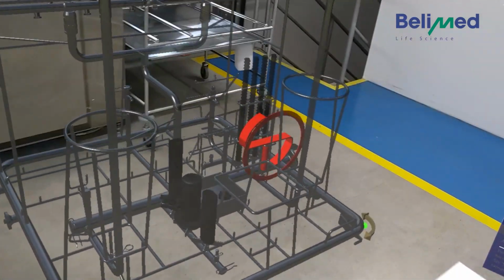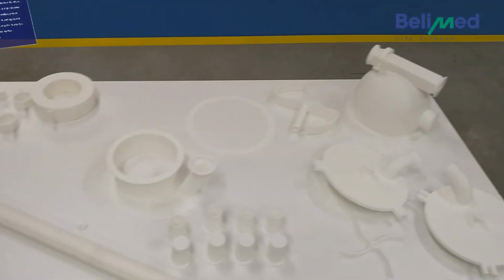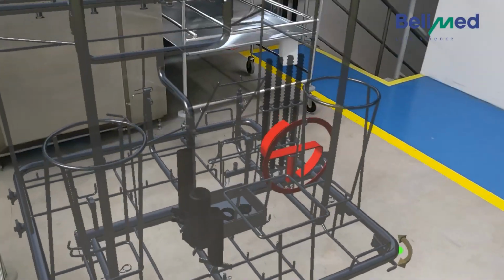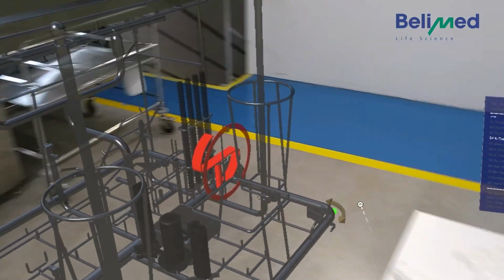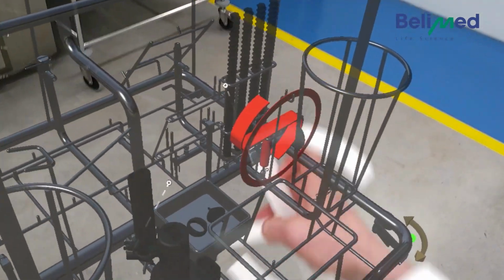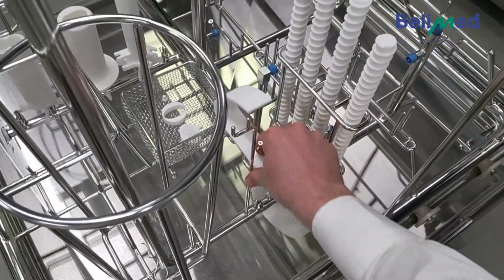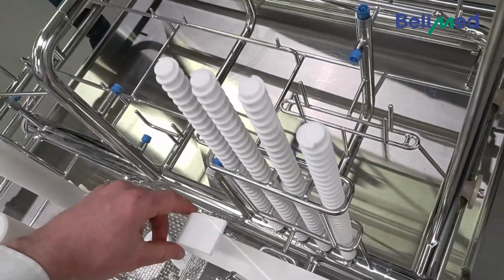So now we have two parts here, the ring and the other thin part we have here, these two. So we can combine parts so you don't have to walk to grab each part by himself. So we have two hands, so that's why we decided to make two now. So we start with this one. It's placed like this. So we place it like this on the nozzle. And the thin ring comes in here. We make sure they do not touch each other.